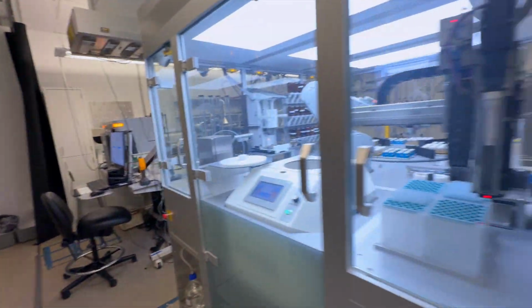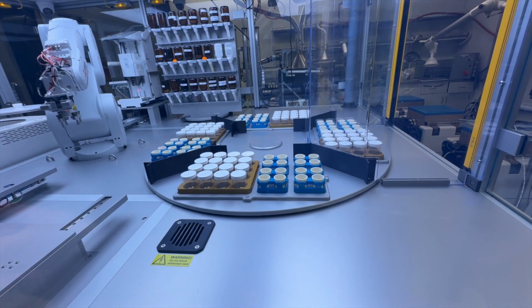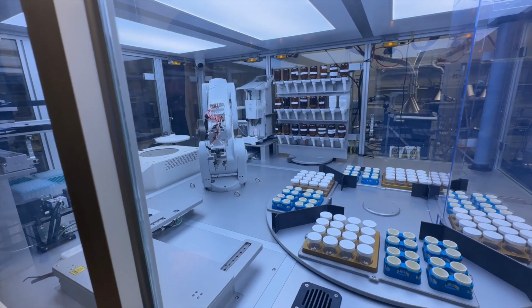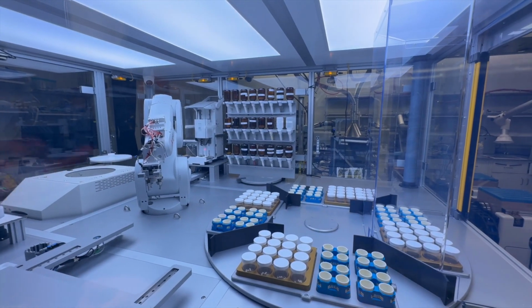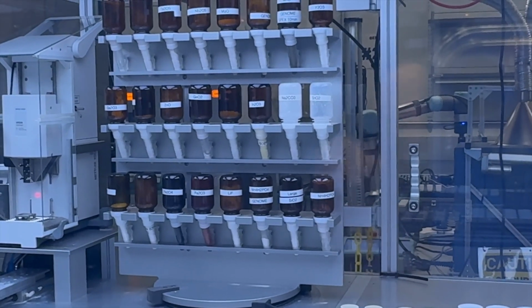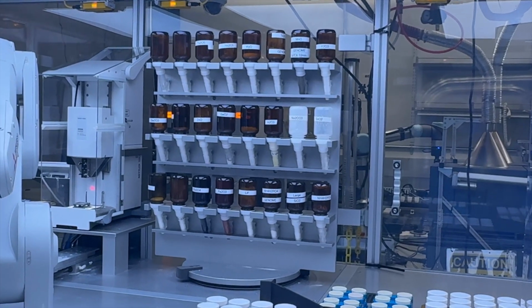So then you've got these containers. What did you call the name of them? Is it crucibles here? Yeah, the crucible is the ceramic one. Okay, the ceramic one's right there. The plastic one is the vial. And then you have in those the bottles. Those are different, is it powders that you have? Yeah. Every single one of them is a different material. Sometimes if we need a lot of one material, we can just have more of that material in more than one bottle. But I think that only happened once.